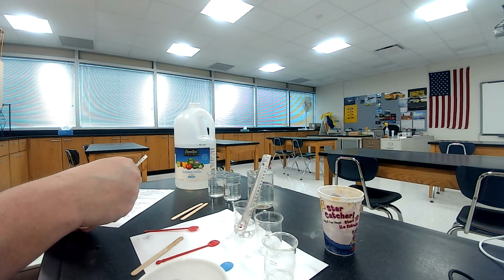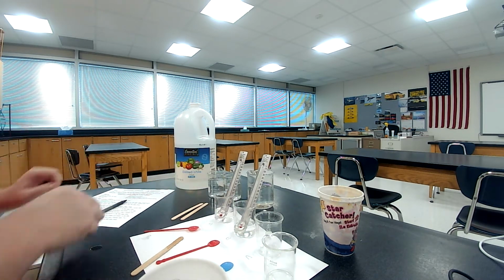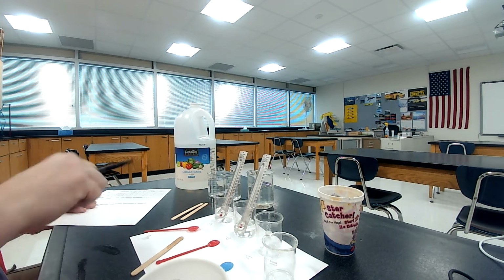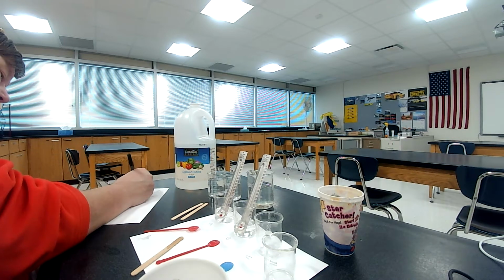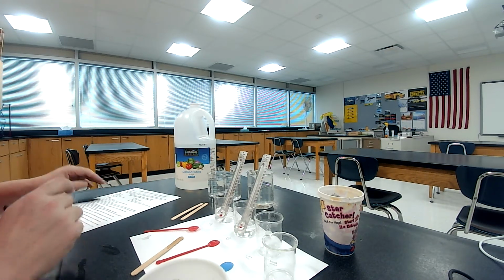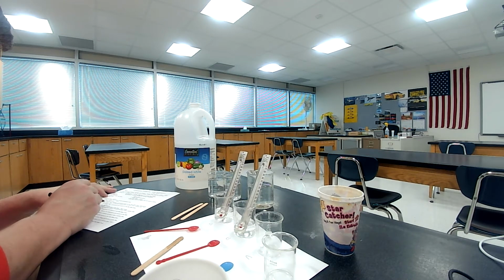Okay, it's looking to be 18 degrees Celsius. So 18 degrees Celsius. So I got a little change out of that. So I'm recording that as my final temperature for beaker A. Okay.